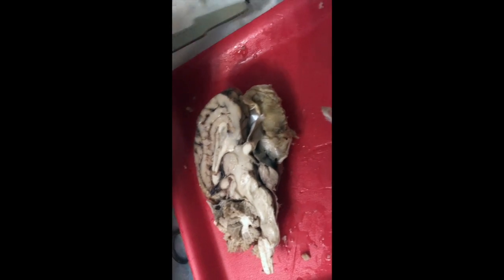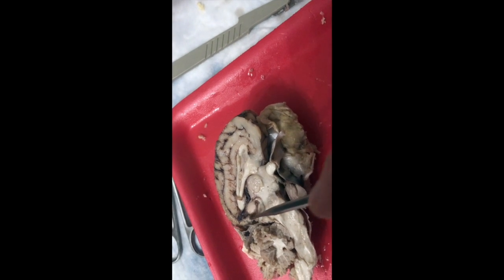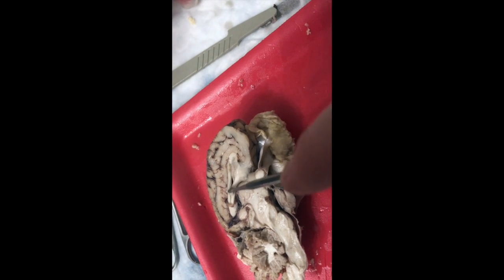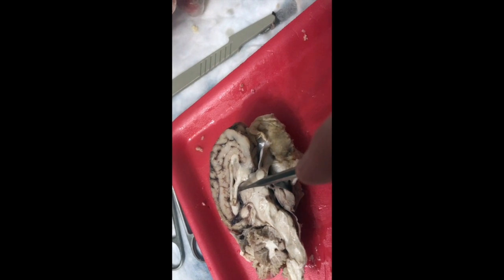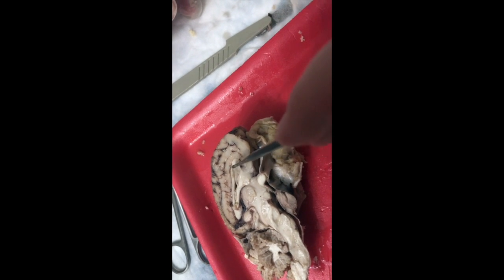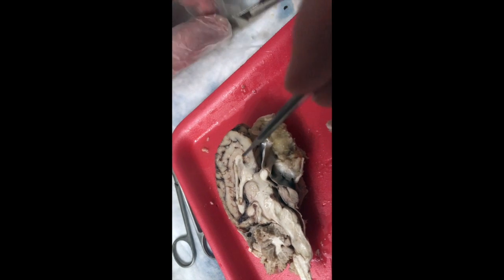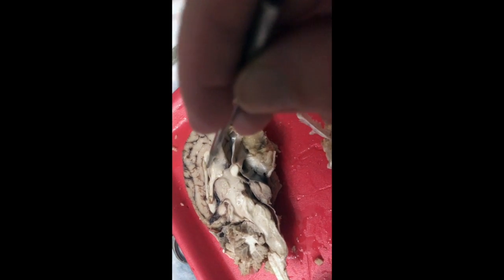Now that we're looking at that mid-sagittal section of the sheep brain, I have my cerebral cortex. We're looking at the left cerebral hemisphere. This white upside-down swoosh right here is the corpus callosum. Remember, we only have one of those. We have the fornix on its inferior side, and this little membrane right here is the septum pellucidum, which separates the fluid-filled chambers in the right hemisphere from the left hemisphere.